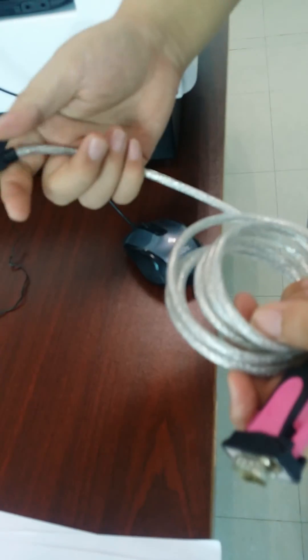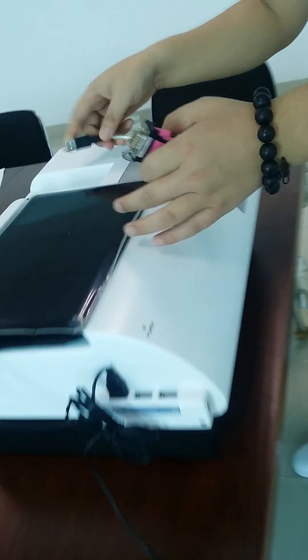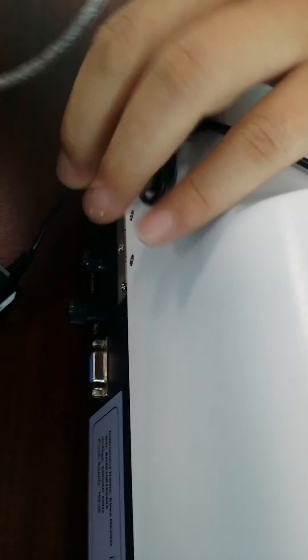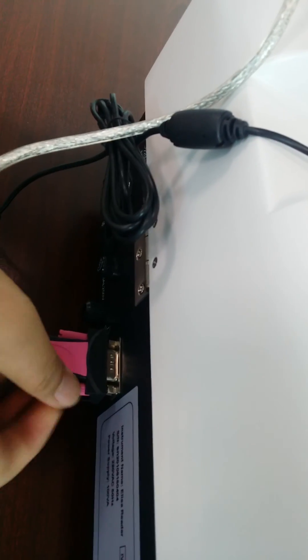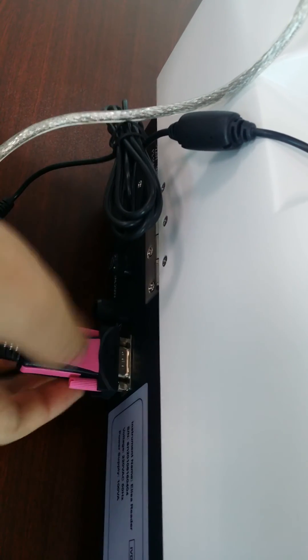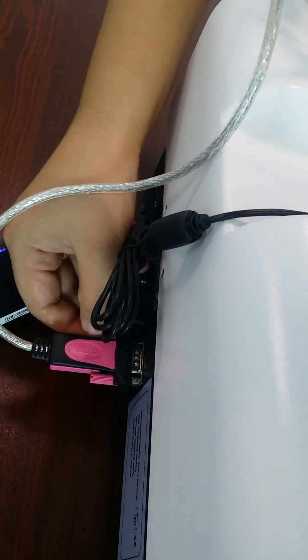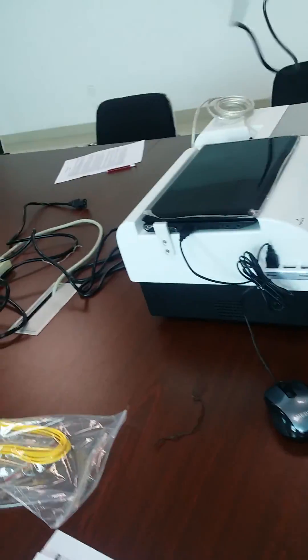These are the RS232 cables — with each cable you can connect the computer with the machine. After you finish this, the last step is to plug in the USB cable.